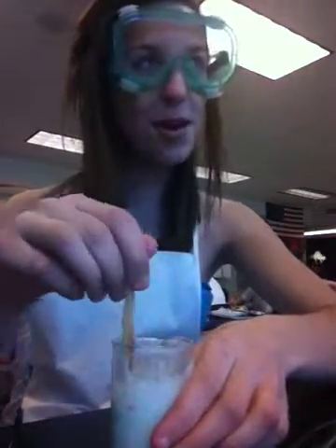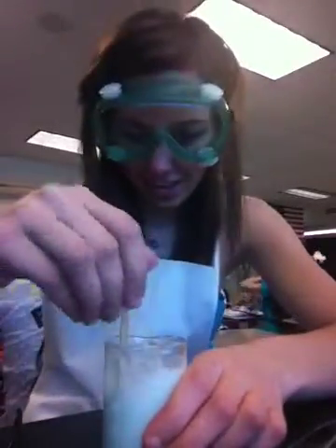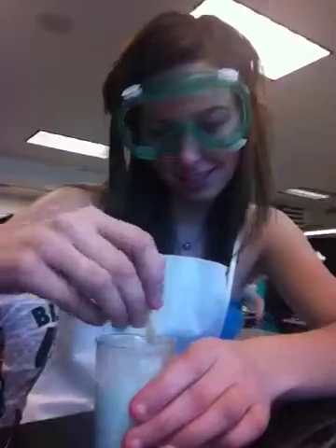Oh, there's a hole in the side of this. Are you really taking video of yourself? Yeah, we're gonna see what this comes out to be. And when it explodes the glass, we will. Probably. You're gonna kill us.